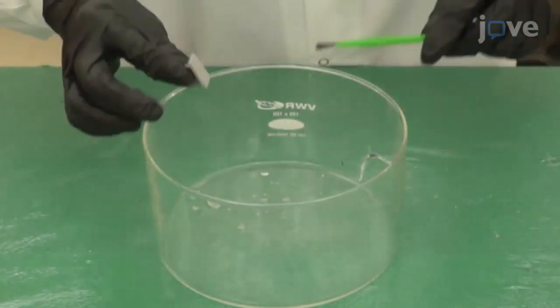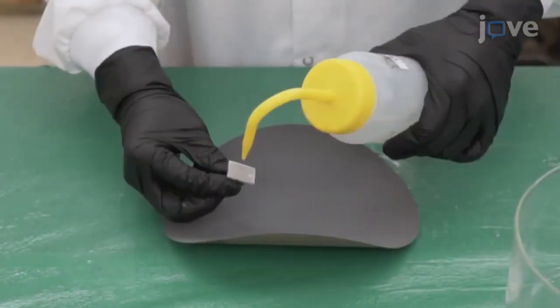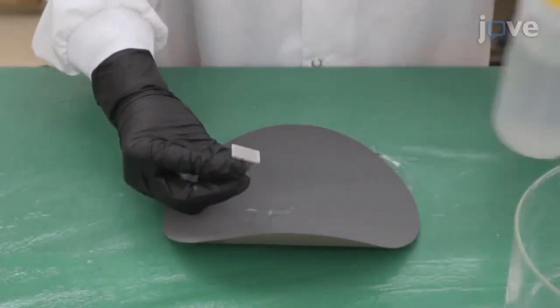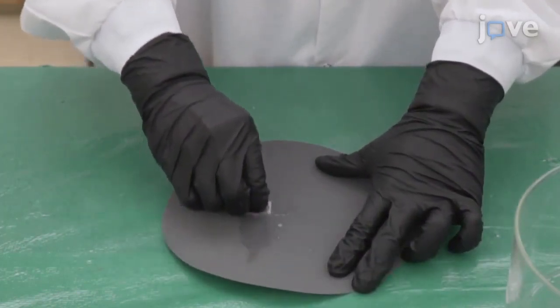Then use a soft brush and running water to clean the sample surface, and rotate and scratch the sample as just demonstrated using 400, 600, and 1200 grit sandpapers.